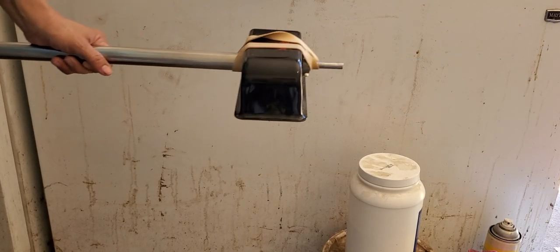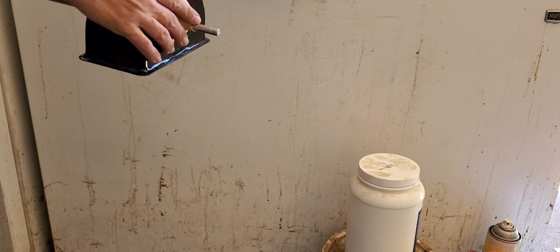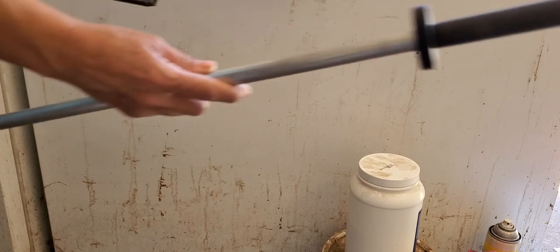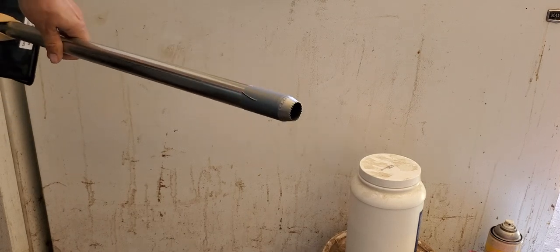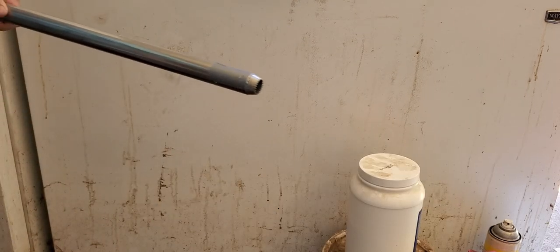In the box there's a piece that goes into your drill, and then it's got the coring end here, and this is a shaft that goes in and out, and a tip there for chomping into the bale. As you push this into the bale, to clear out your sample you feed this back down the barrel, and I'm going to put a gallon plastic bag on here to catch the hay sample.